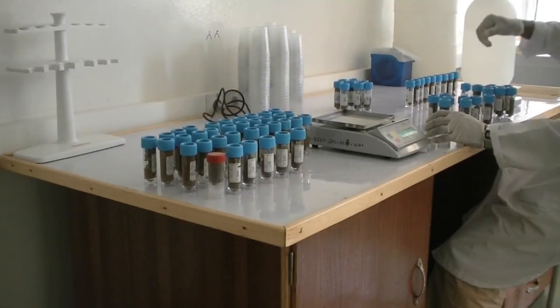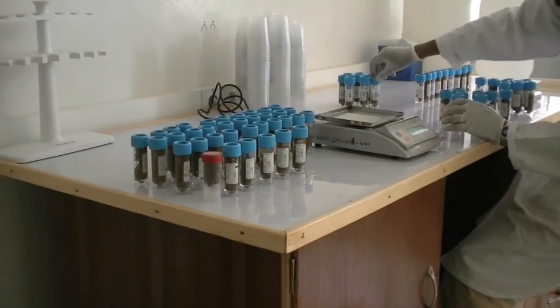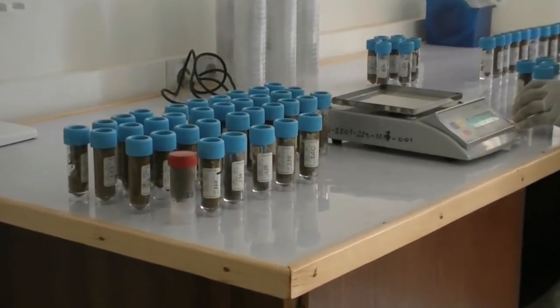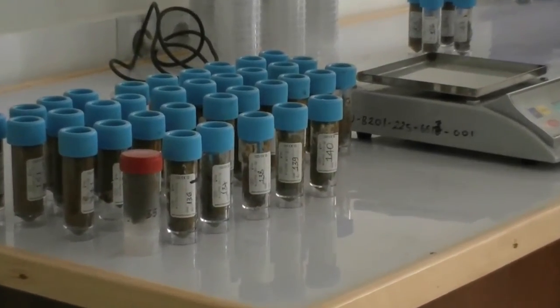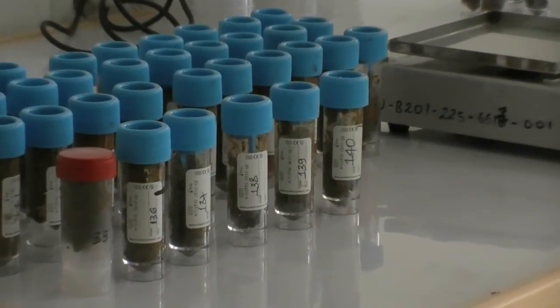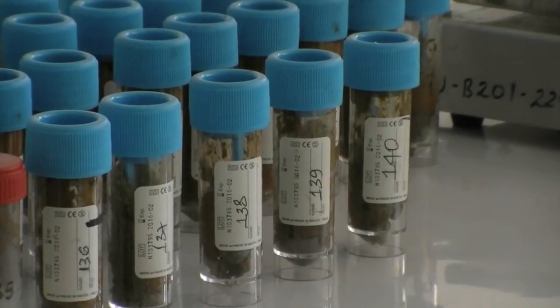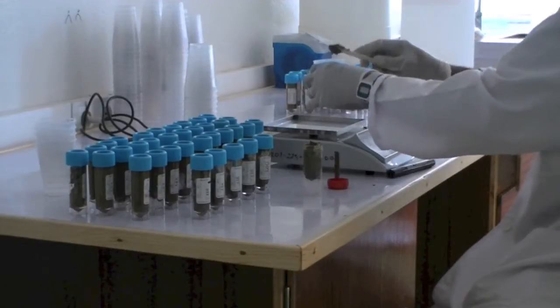In the field, a unique number is randomly assigned to the stools of the subjects. In the lab, however, it is recommended to rank the samples according to their number. This will allow identifying any mislabeling from the field, such as a number that was accidentally used twice. In addition, it will facilitate quality control. It is recommended to split the total number of stool samples in half.